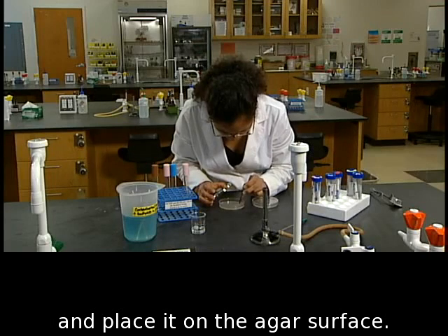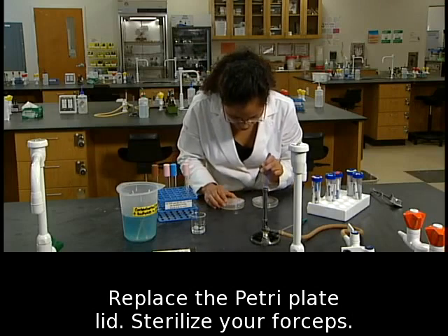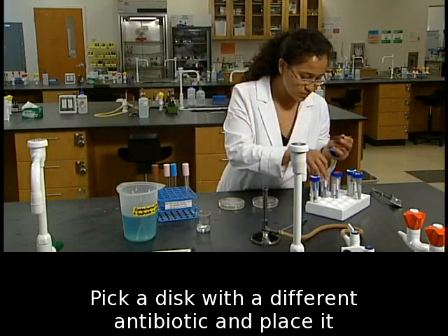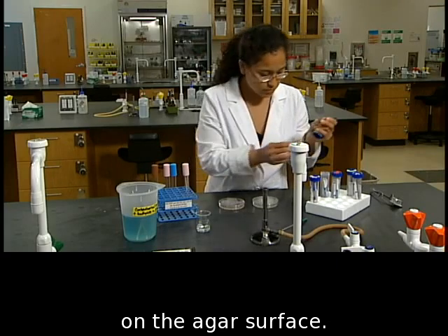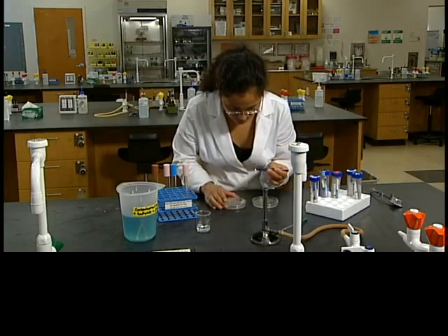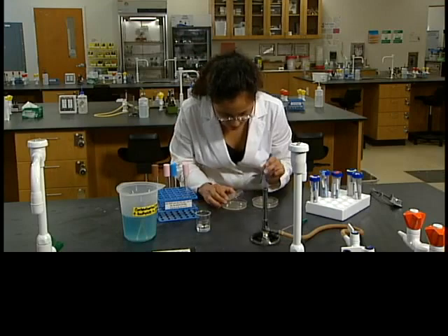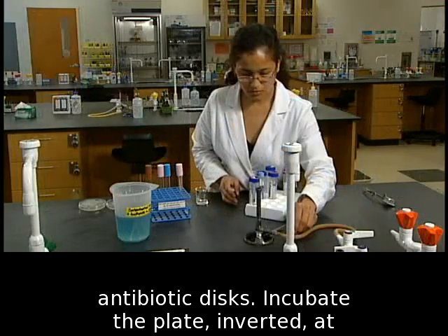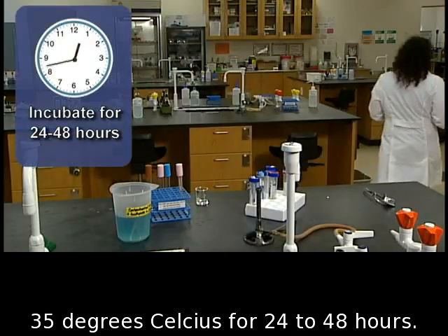Place the disc on the agar surface, then replace the petri plate lid. Sterilize your forceps, pick a disc with a different antibiotic, and place it on the agar surface. Repeat this procedure to place five different antibiotic discs. Incubate the plate inverted at 35 degrees Celsius for 24 to 48 hours.